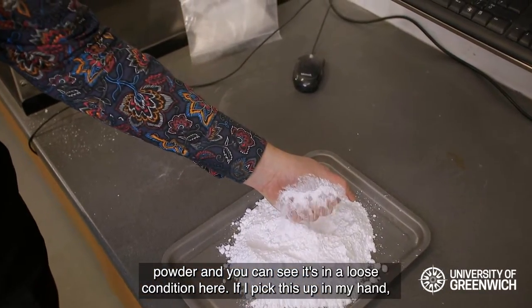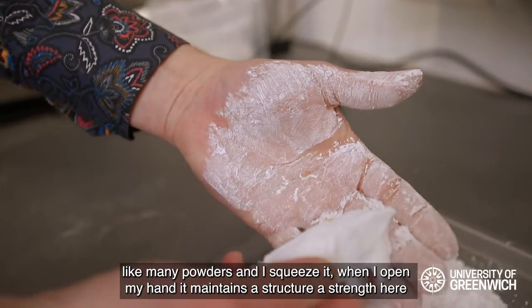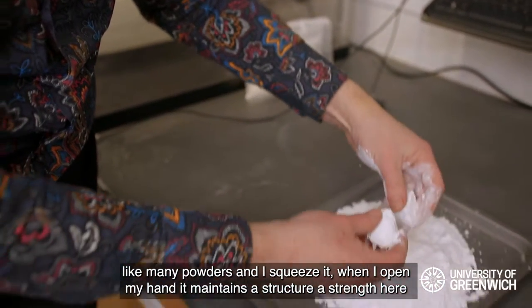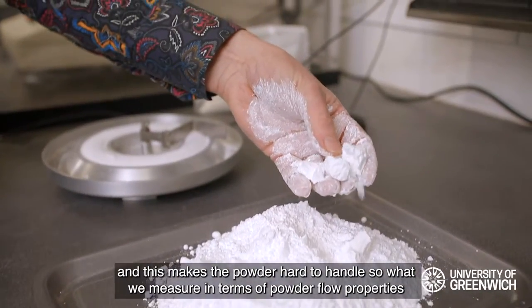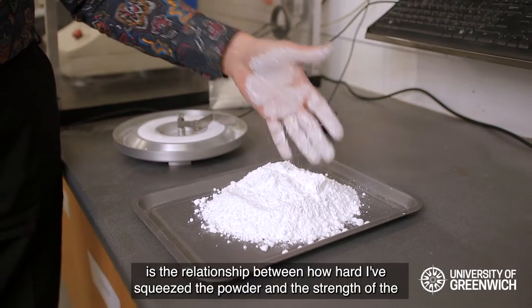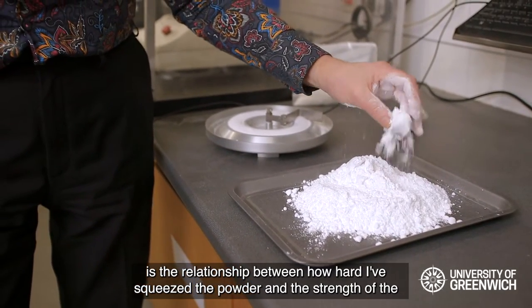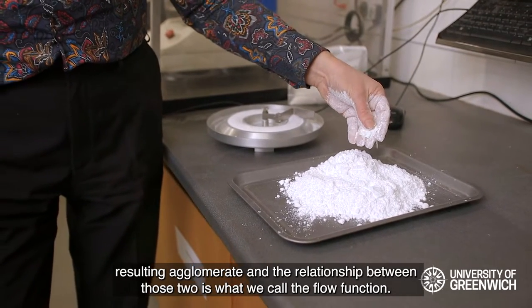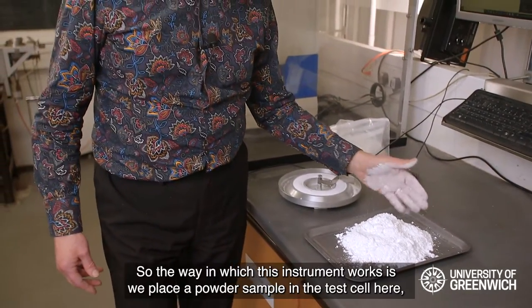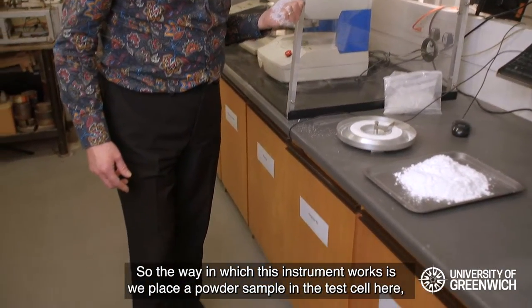If I pick this up in my hand, like many powders, and I squeeze it, when I open my hand it maintains a structure — a strength — and this makes the powder hard to handle. So what we measure in terms of powder flow properties is the relationship between how hard I've squeezed the powder and the strength of the resulting agglomerate. That relationship is what we call the flow function.